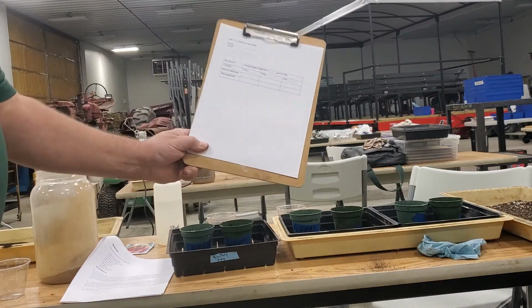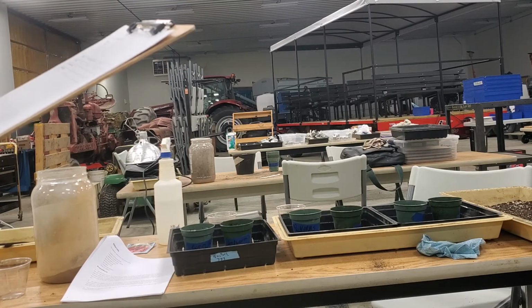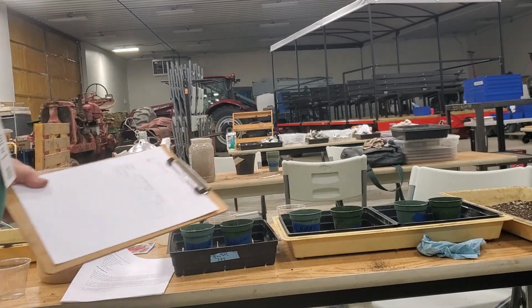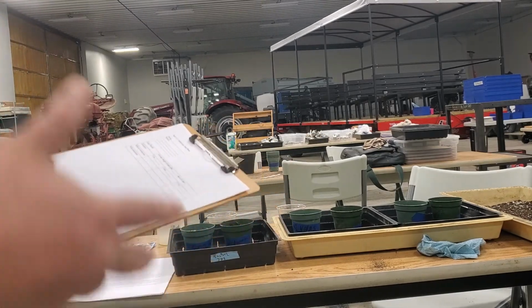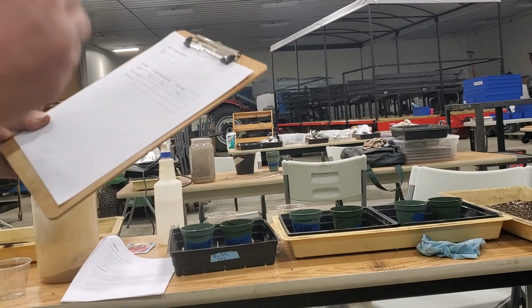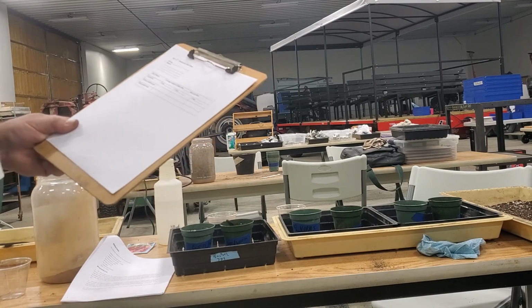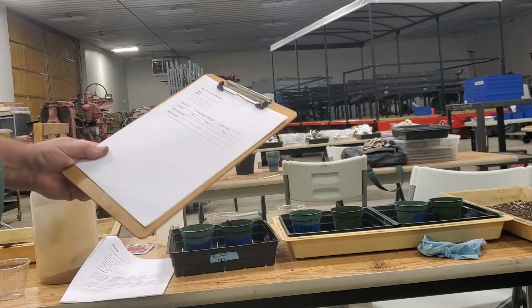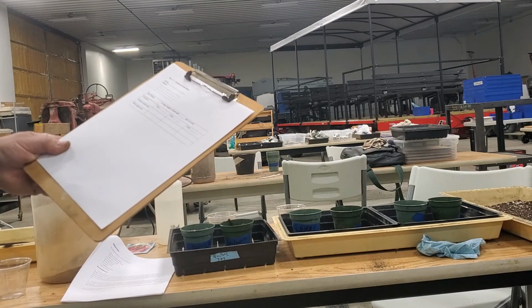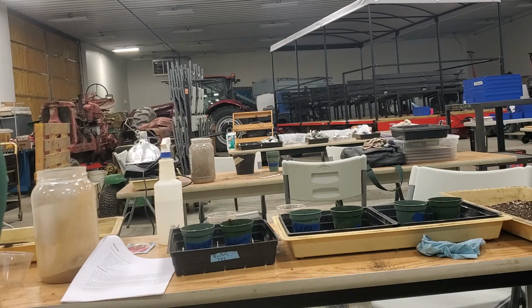You have a data sheet. Basically, all you can put today is the date that it was planted. So we've got, what is it, 11/20. Actually, you'll be watching it. I planted it on Tuesday, so that's going to be 11/24. And then you can fill in the crop. You can put corn for the first column, beans for the second column, and radishes for the third column. And then we've got without earthworms and with earthworms. And then I'm going to come in here and take the height after so many days.